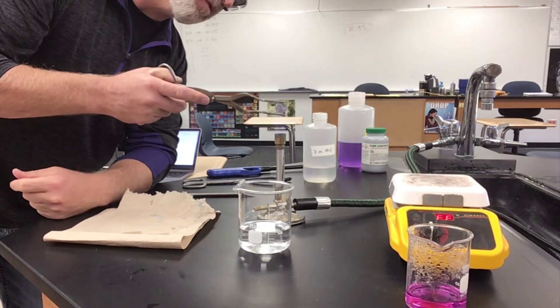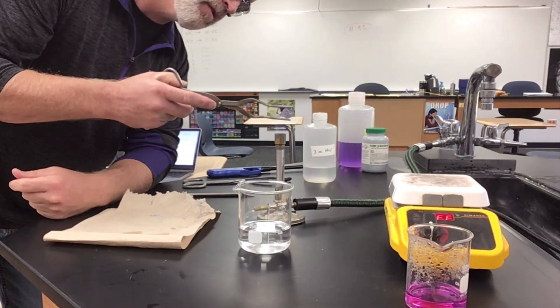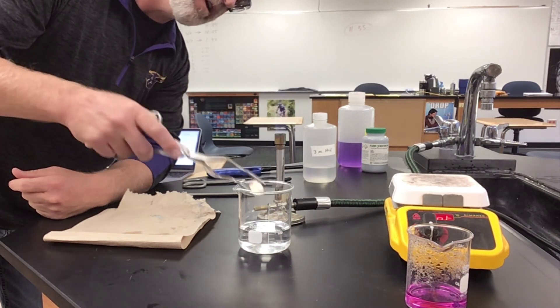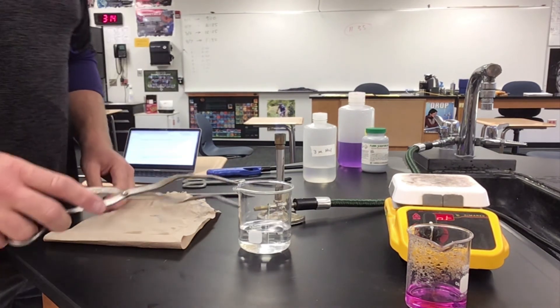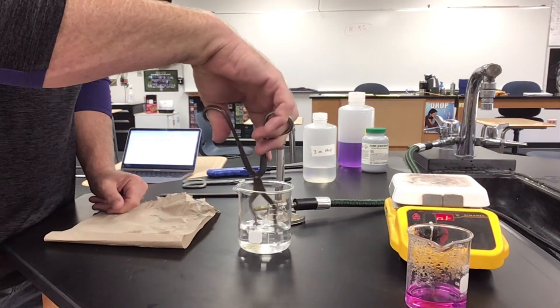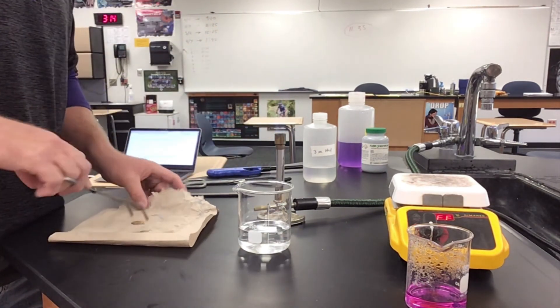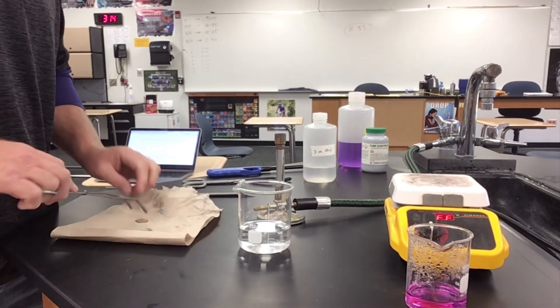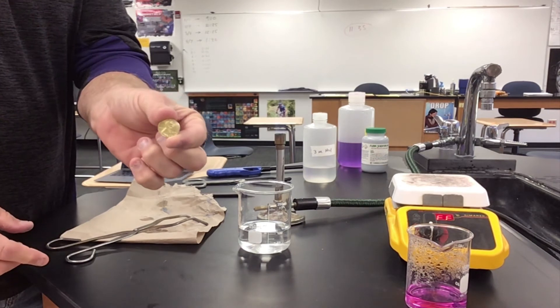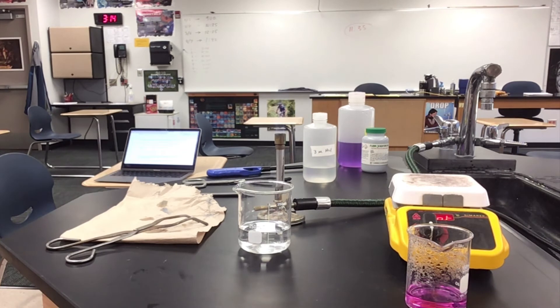Holding it in the flame, waiting for the color change... there it is! And I'm done — it happens that fast. If I did a good job, when I'm done we have a brass penny.